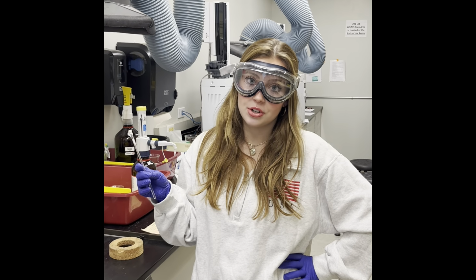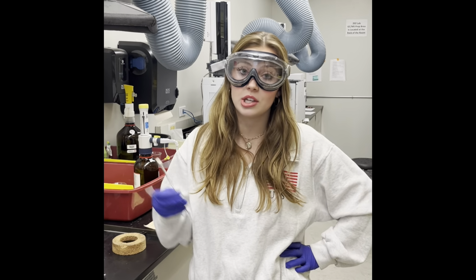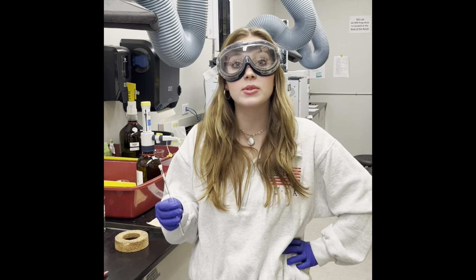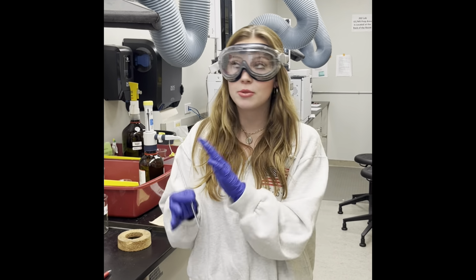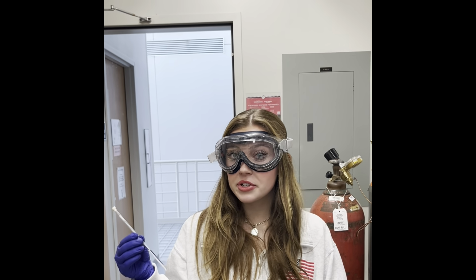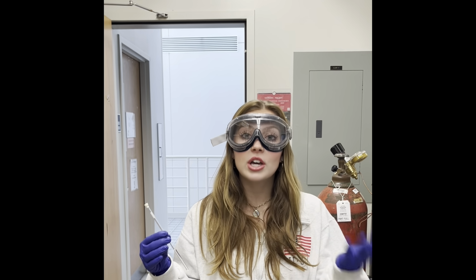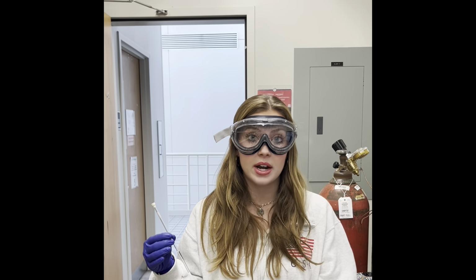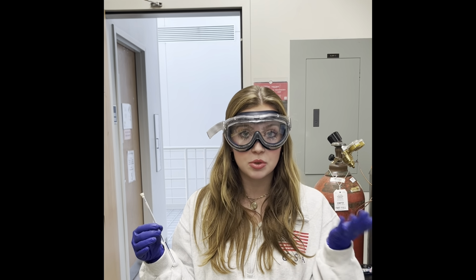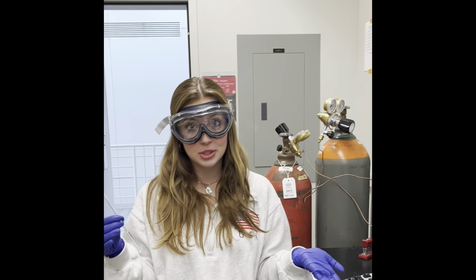You shouldn't need to. Besides, if you shake the tube, you could risk breaking it, which would not only make a huge mess for yourself, but it also would pose a hazard. If you do break a tube for any reason though, make sure you put it in the broken glass bin to the left of the computer. Now that we have our sample mixed with our solvent and we know the solvent level is at the correct level, we can go ahead and put our sample in the NMR rack and put all of the information we need into the computer. If you want to hop on the computer, I can tell you what to do.